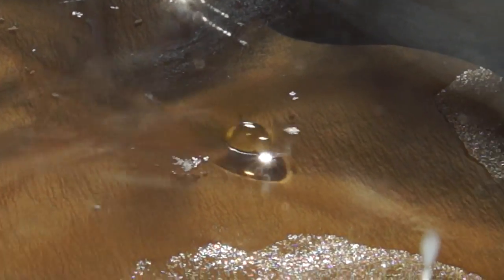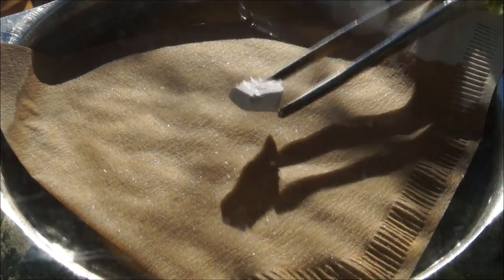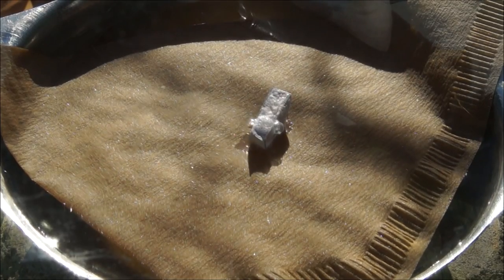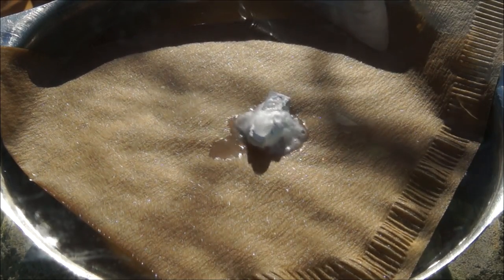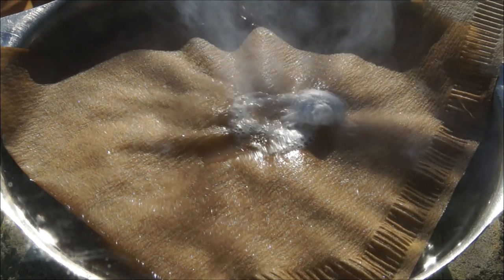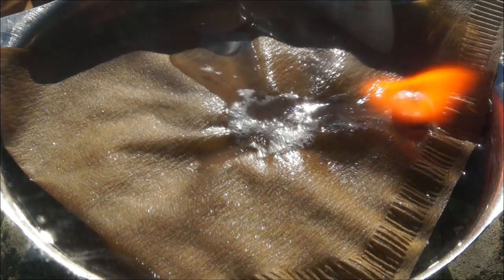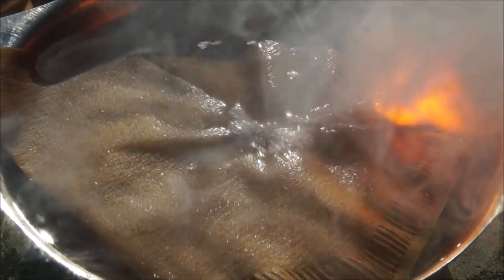Whether we are dealing with transparent sodium or any other substance — such as sodium hydroxide or a sodium hydroxide mixture with water in unknown proportions — why the droplet becomes perfectly clear is a question I still cannot find the answer to.